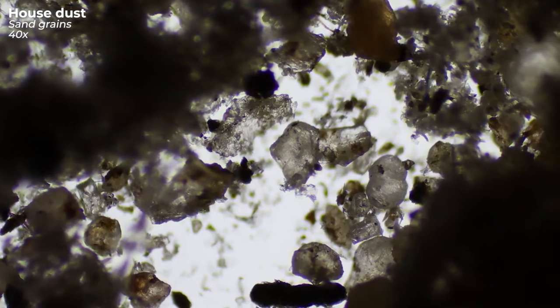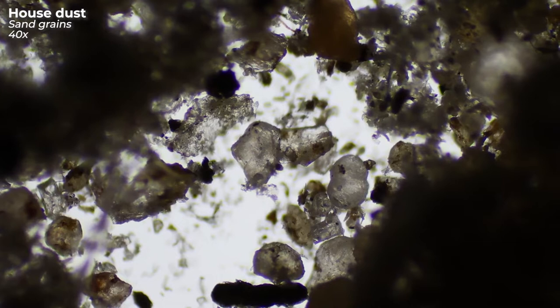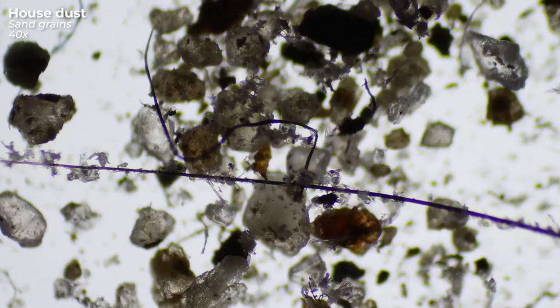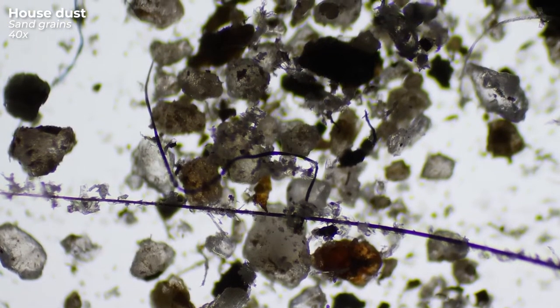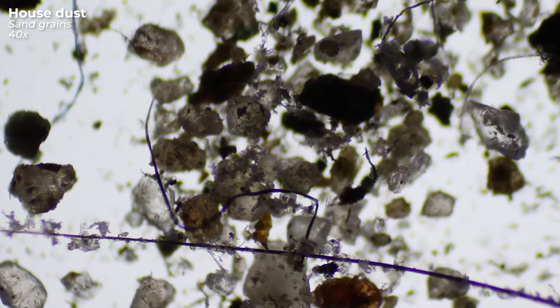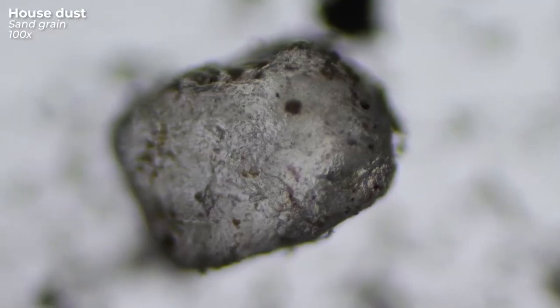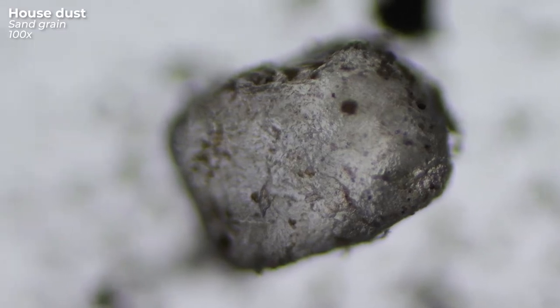All these particles here are grains of sand. Usually sand gets into our homes through our shoes. In my case, my fluffy dog brings most of the sand into my apartment because it's his favorite activity to roll around in the dirt — and since I live in a rather rural area, he gets the opportunity to enjoy his favorite activity every day.